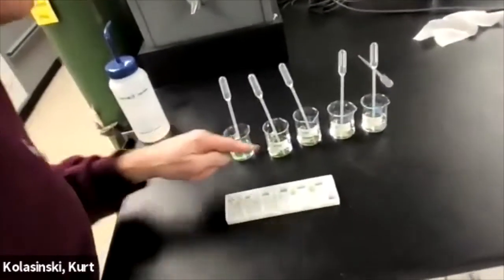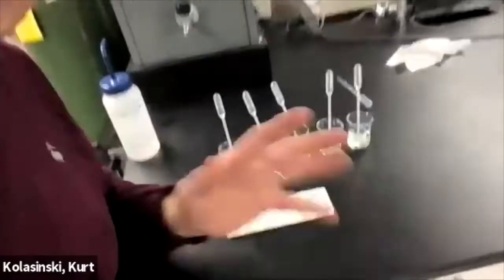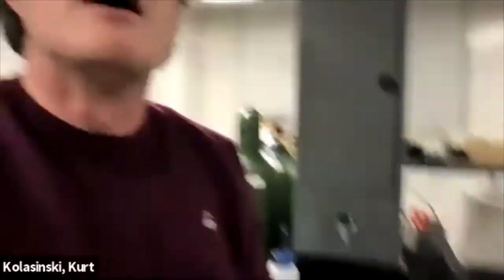We pipette into some 50 mL beakers, nicely cleaned. Everything was cleaned. This is another thing—you have to rinse those pipettes beforehand with distilled water. And then you should also rinse them with the solutions that you're going to pipette into them. Good pipetting technique. Rinse out your bulb too.